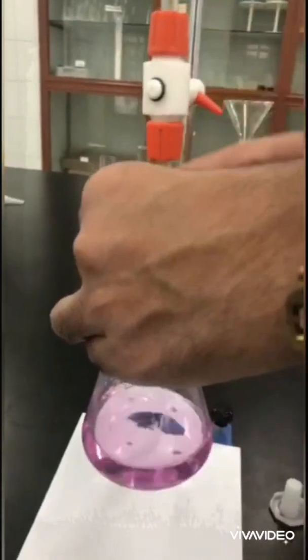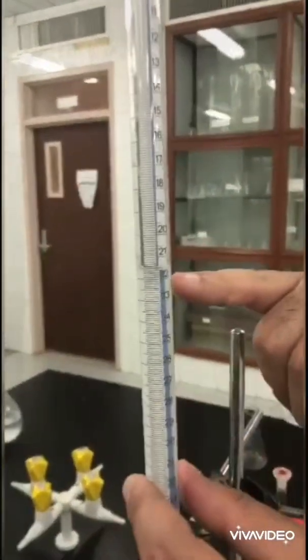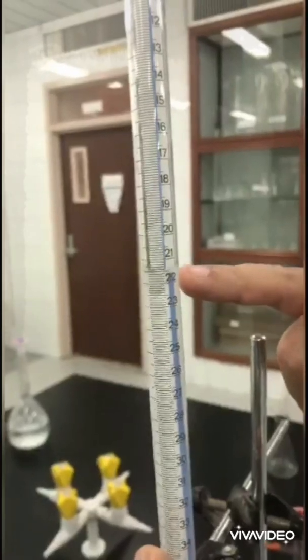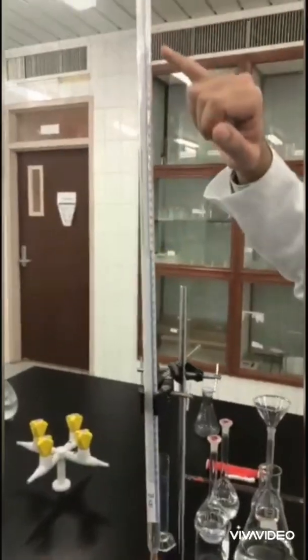Yes, that's it. Can you observe the pink color? Now let's take the reading of the burette.